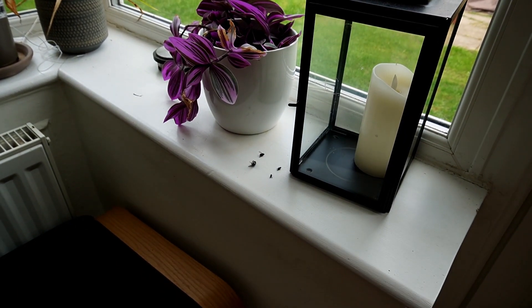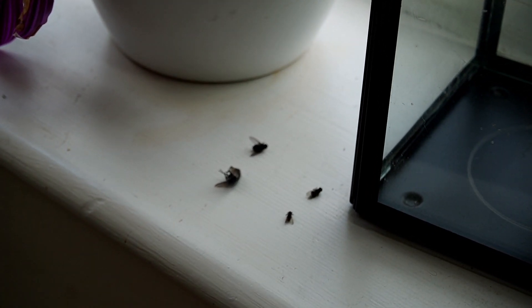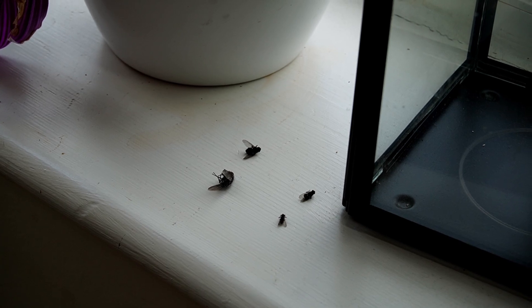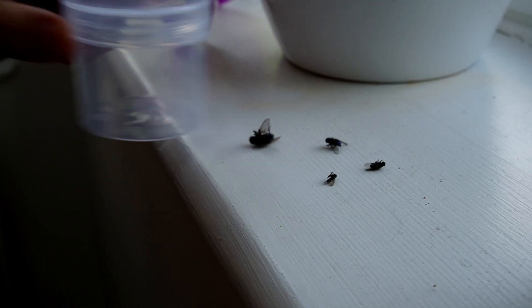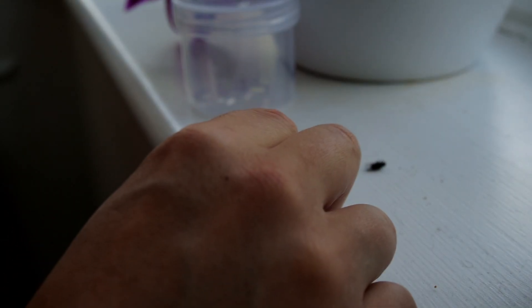I accumulated a collection of flies and these were the best specimens I could find. I was particularly interested in the larger fly because it would make for a good time-lapse, however I knew I needed something which could stand by itself and was stable for this. And I was desperate — absolutely desperate — for this fly to work.